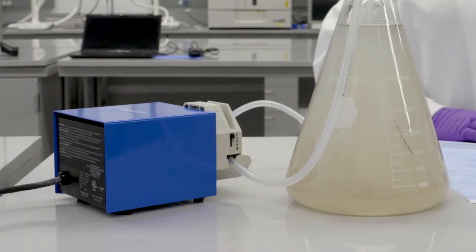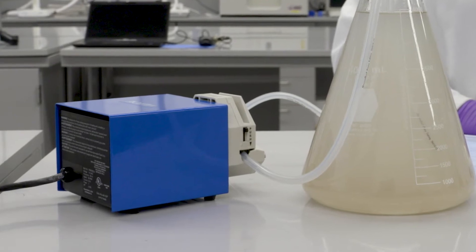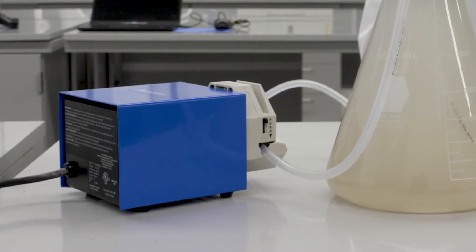Set up the pump with tubing up to 3/8 inch ID tubing. Turn on the pump briefly to prime the system over a waste container.